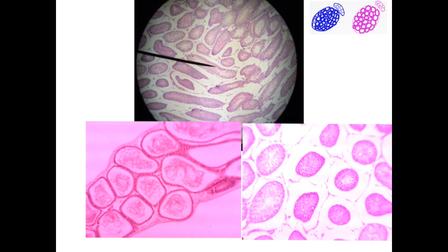The other compound slide is the testis and the epididymis. The color has no significance. They may come in the blue color, both of them, or red color, both of them. This depends on the staining. And of course, the big mass is formed of tubules, which have a thick wall and relatively narrower lumen, while the small mass is formed of wider tubules with a thinner wall, which is the epididymis.